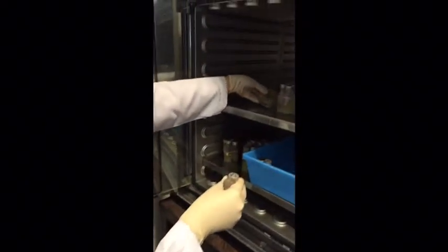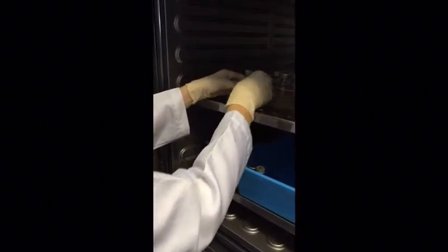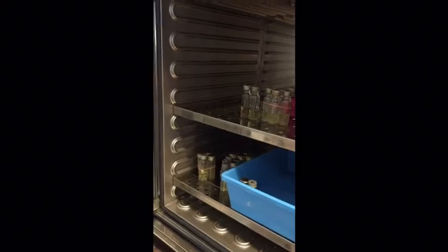And now we have done the first sample, that is from the kolam water, and so we will repeat the same step for the water sample from the water cooler. After we have done the streaking, now we will incubate it for 24 hours at 37 degrees Celsius. And now we will put our sample into the incubator.